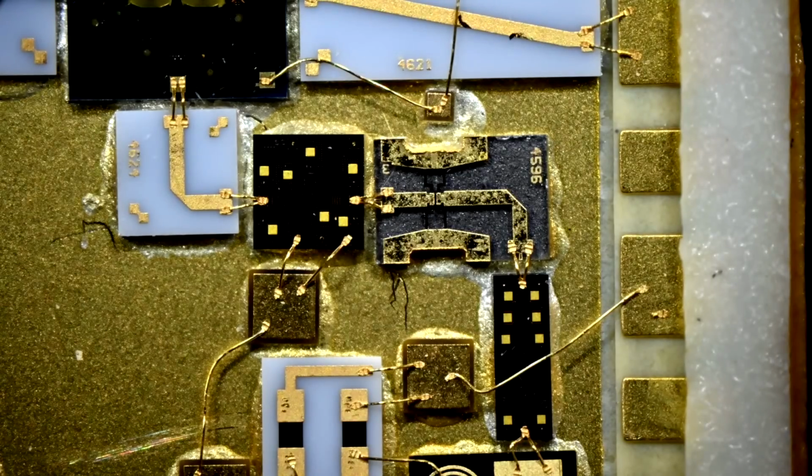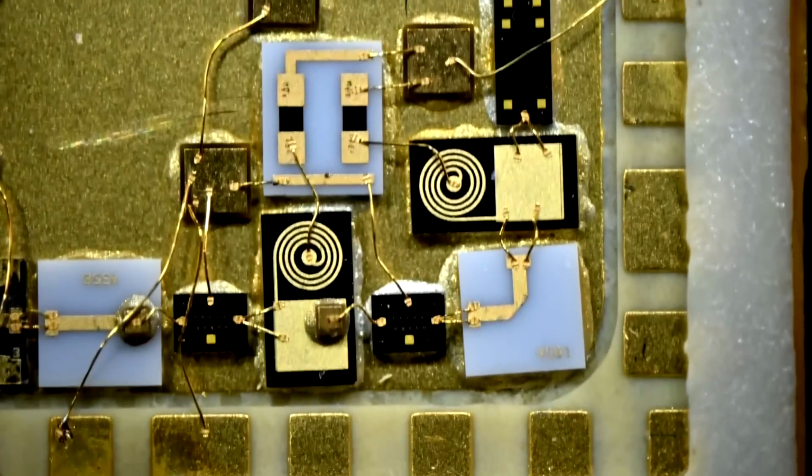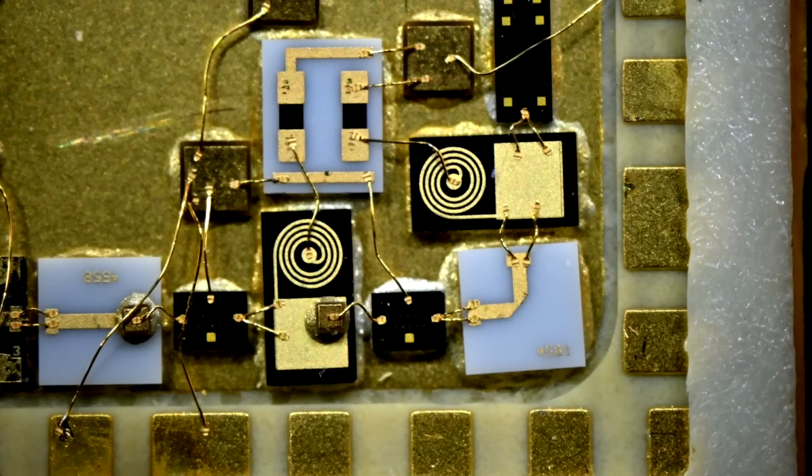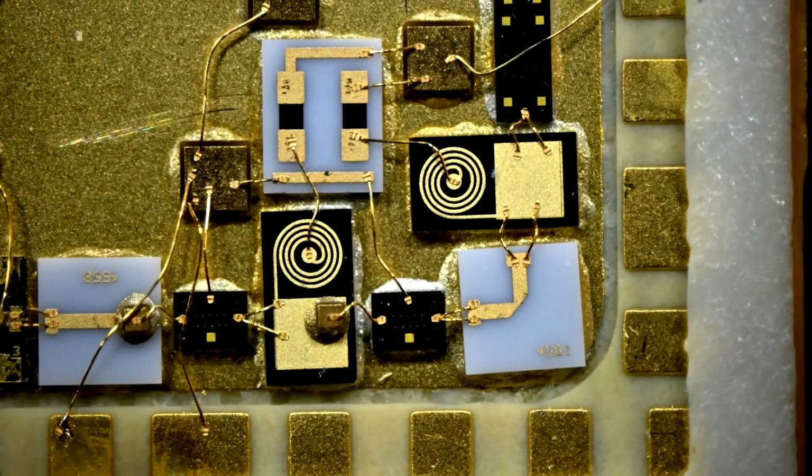And here, even in this magnification, doing some focus stacking would help, because you could get the wire bonds to be completely in focus. Here you can see the ceramic pieces, everything here. Look at these cool inductors and everything that's hand assembled, totally custom made. We've done a reverse engineering of this module when I was doing that repair. But even for something like this, focus stacking would help a lot. And images are really, really beautiful.